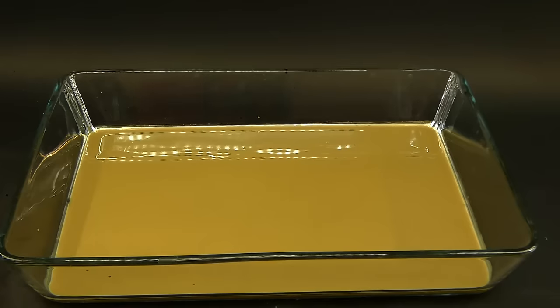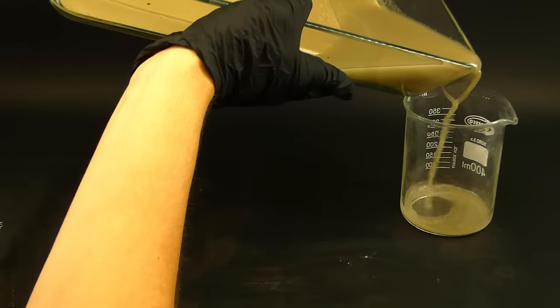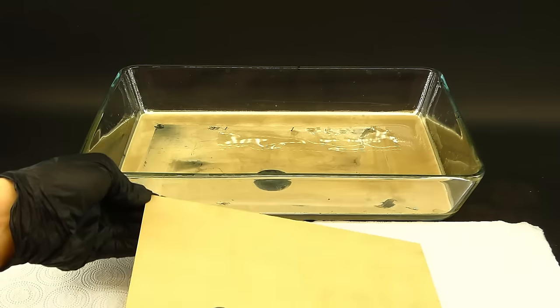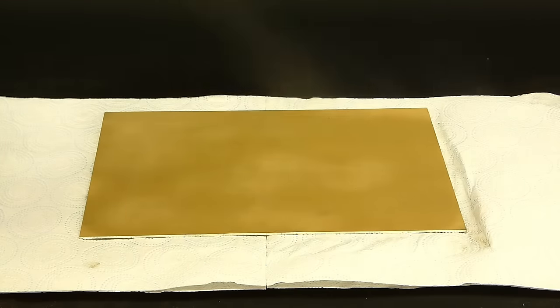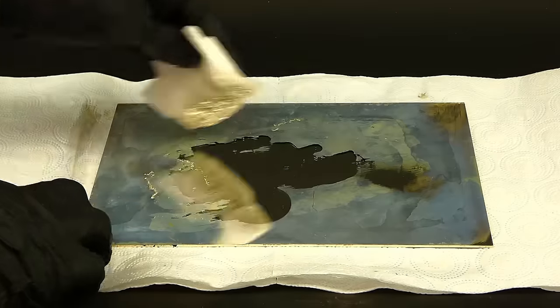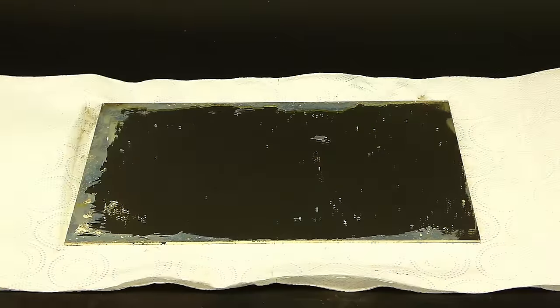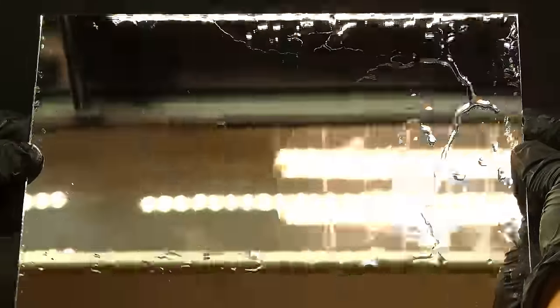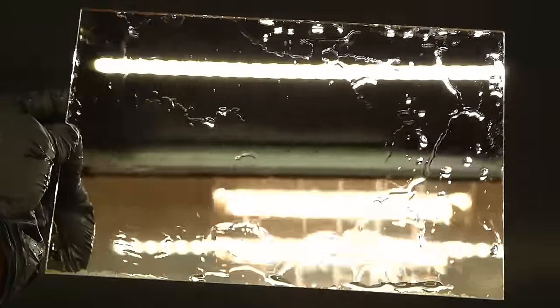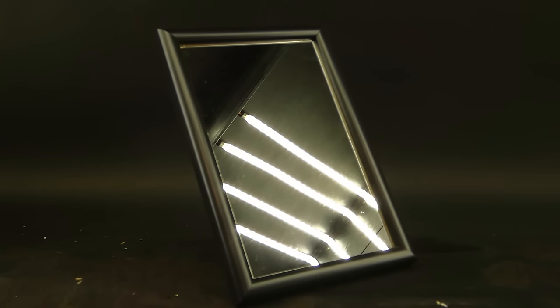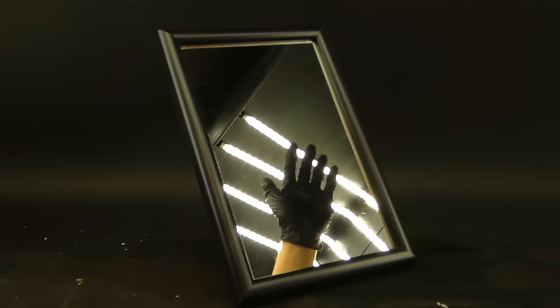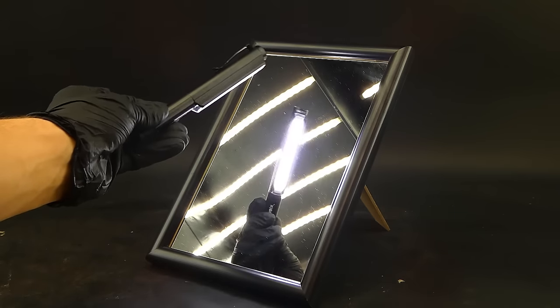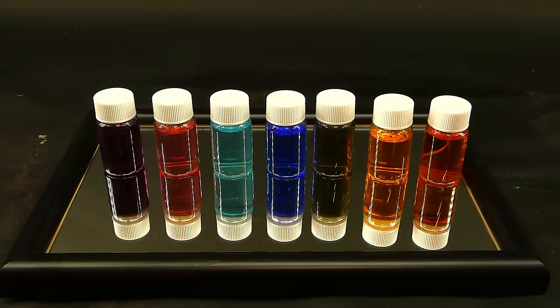The whole process went similarly to the last time, and when it finished, I drained all of the wastewater and thoroughly washed the mirror with distilled water. I then got it onto some paper towels and dried it using my trusty computer fan, which looked really satisfying. Then I applied a very generous coat of the acrylic paint. When it dried, I got my first look at the unfinished mirror, and it already looked gorgeous. I then removed the upper silver layer using some dilute nitric acid, revealing a pretty much perfect mirror below, and then rinsed the glass using some water, and oh my, was it beautiful. I mean, it looked just like a real store-bought mirror, and when I got it back into the frame, I was just out of words. I literally managed to create a real, perfect mirror from some old jewelry, which is just one of the coolest things I have ever done. This mirror is so great that it doesn't let light through like the other ones. It also beautifully reflects a laser and mirrors objects, and it is just generally awesome.